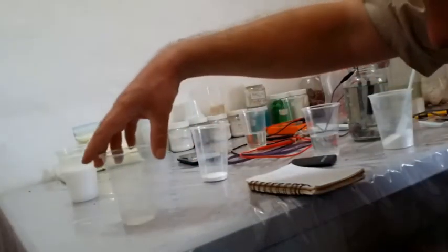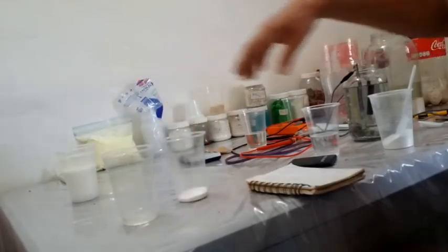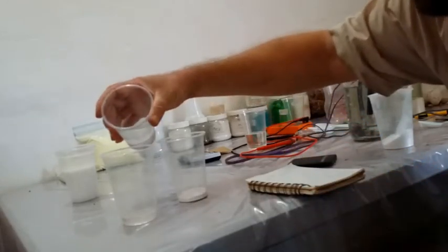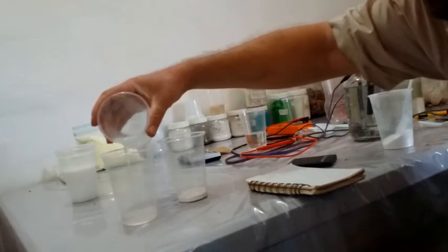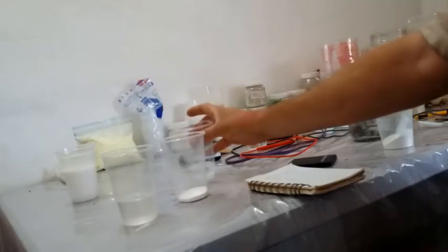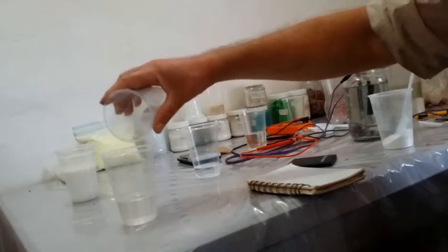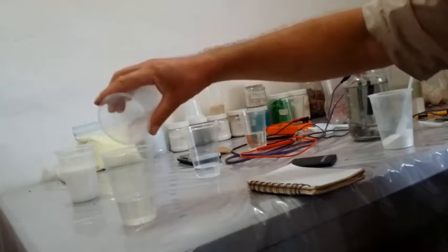So there's my two that I need. Now I'm going to add a little bit of water to help this reaction along, because otherwise I'll just end up with a solid mat. I'm going to add this little by little. If I add too much, this will bubble right over.